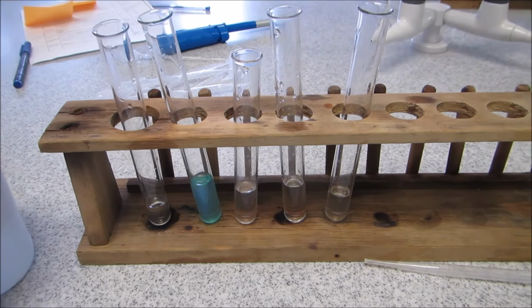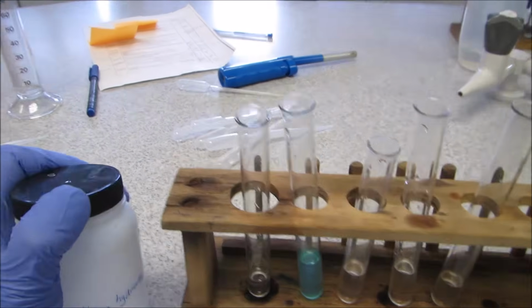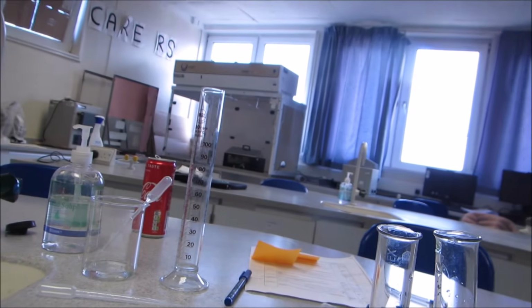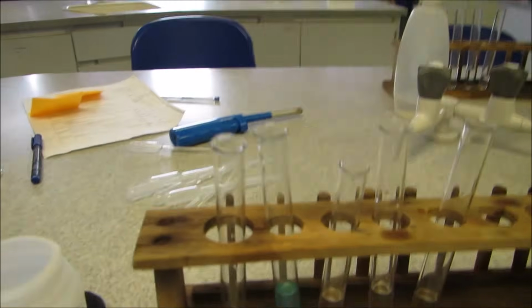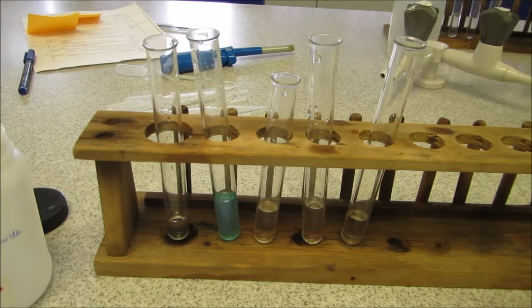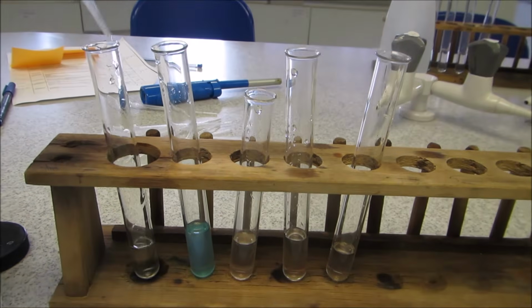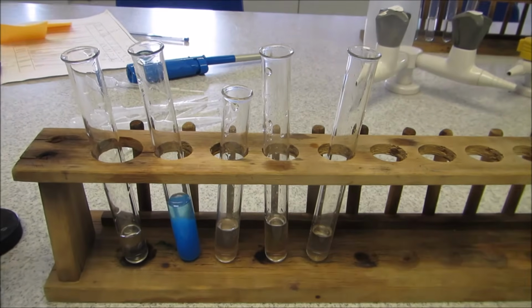So firstly, to work out the cation, in these test tubes I have measured out some of each of my salt solutions, and then for the cation test I'm going to add sodium hydroxide and observe any of the reactions. I'm not going to talk you through these reactions, I want you to look at the previous videos to decide yourself. So I'll just add sodium hydroxide to all of them.